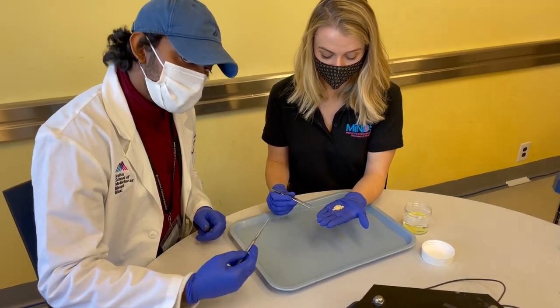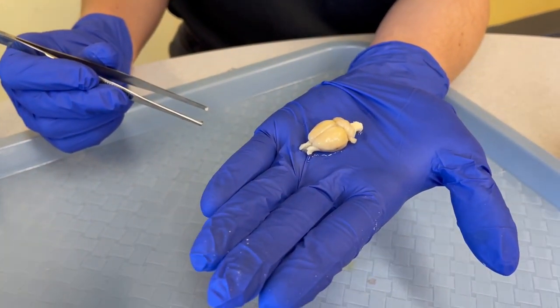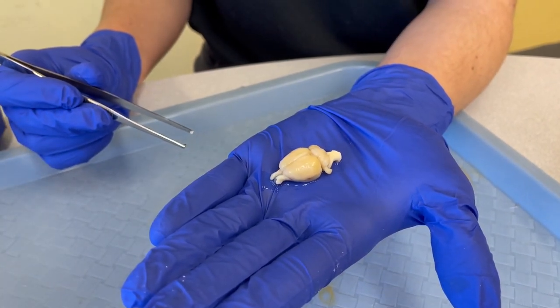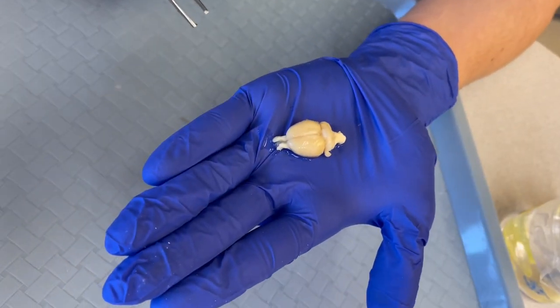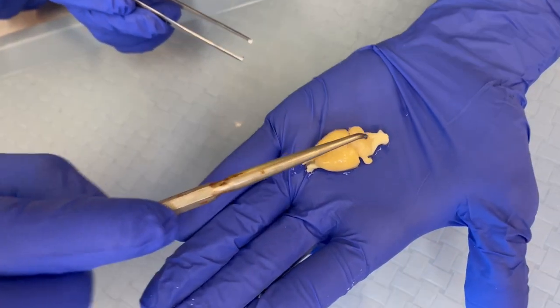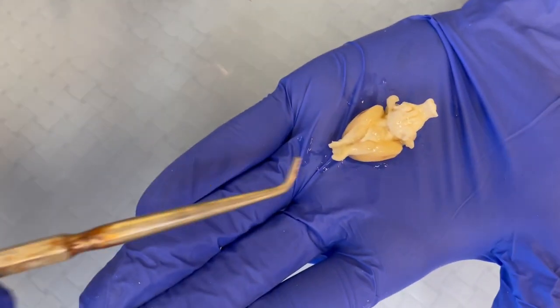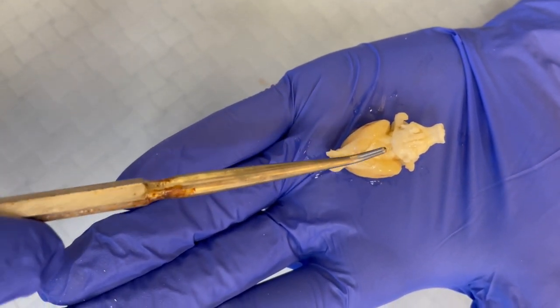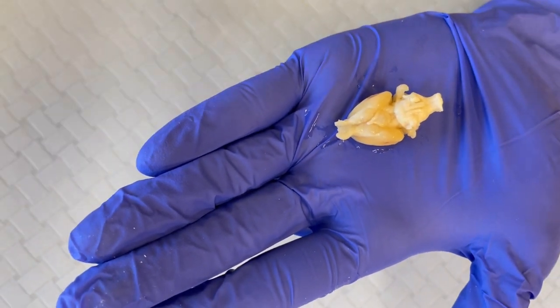Now we have the rat brain. You can see that it's noticeably larger than the mouse brain, but the structures are actually quite similar. Once again, you have the huge olfactory bulbs, which give them their wonderful senses of smell, and then the hemispheres. You don't see a very complex folding pattern for gyri and sulci, but you do see a bigger cerebellum, the vermis here that connects the two hemispheres, and the brain stem right below it. If we flip the brain, we can see the complex architecture at the base, the olfactory bulbs, the optic nerves, and the brain stem and midbrain region.